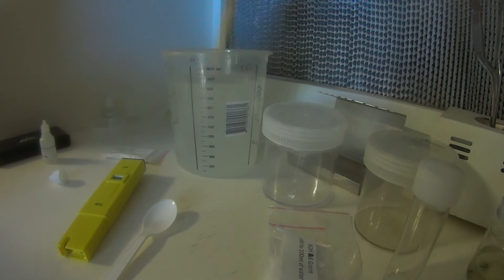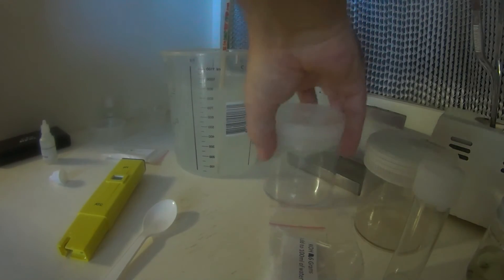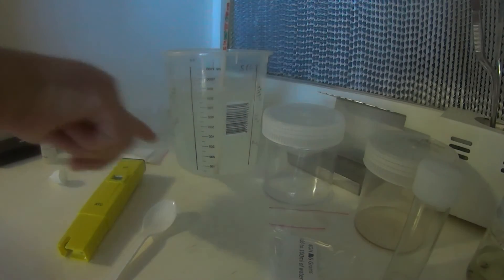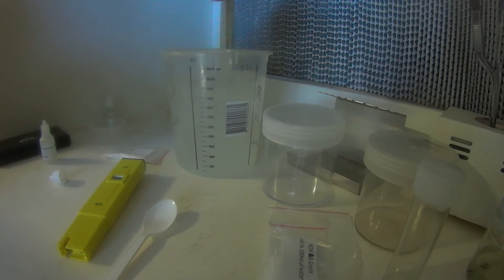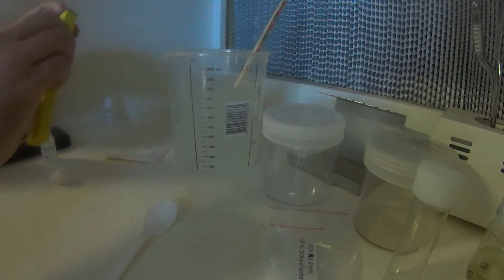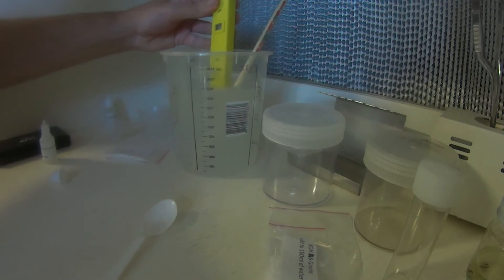Now, saying that Gelrite doesn't actually dissolve, it comes suspended in the solution, but if you leave this solution sitting around for too long, it will settle out, but it's just a simple matter of giving it a quick stir before you're dispensing into your containers. Otherwise, the last few containers obviously will have more Gelrite in them, and be a lot of solid. But there we go, that's all mixed in, I'll just give it a quick test, and adjust accordingly.